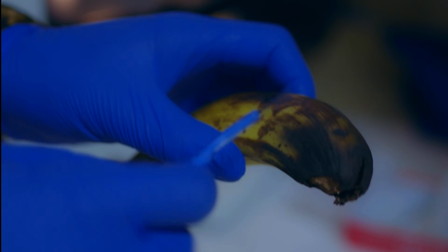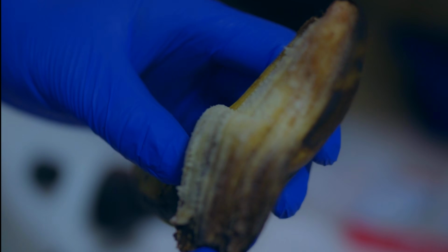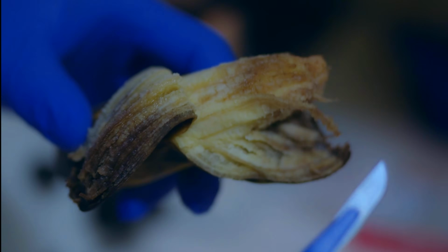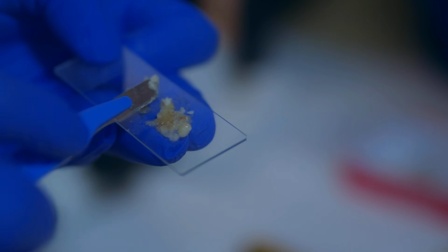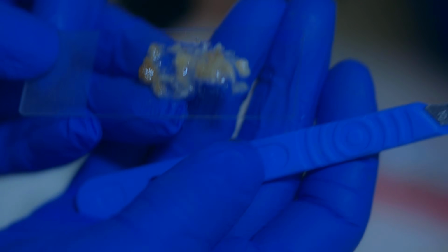This one is rotten. I'm sure you can tell, and you can even see this is quite rotten, and we're going to pick especially these juicy parts. This is where we might find some organisms that you are really interested in. And make our smoothie smoother so that we can be able to see through the microscope. So this is a rotten banana, and we'll see what we'll find there in a few.